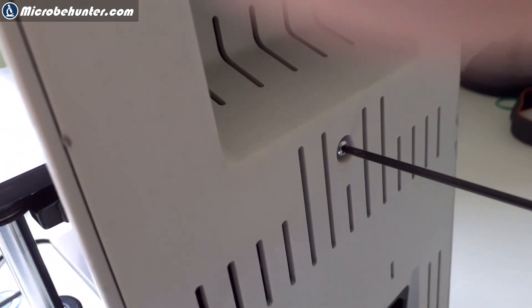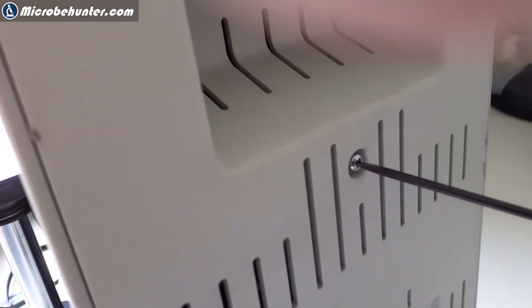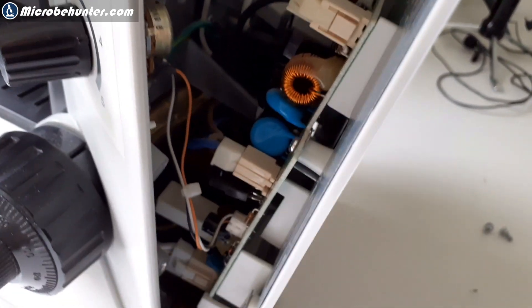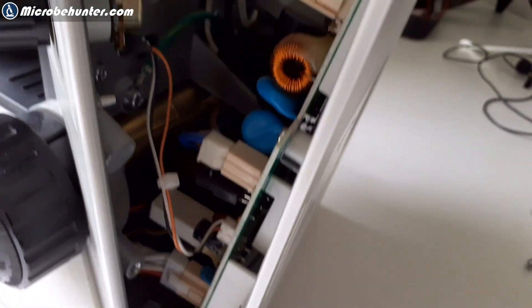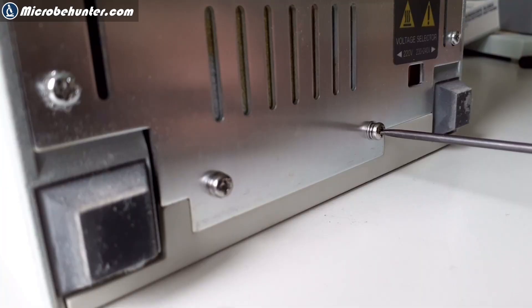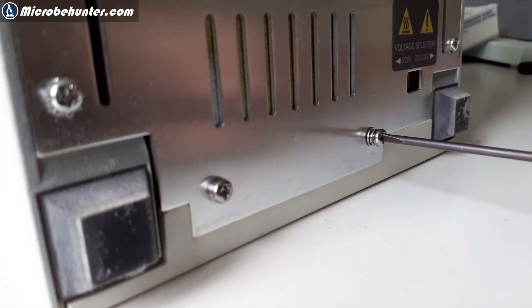I tried to clean pretty much all of the parts that could be accessed, but the dirt still is there. So I said, okay, it's time to give a general cleaning. I started to take the screws out in the back of the microscope. There are lots of electronics in there, transformers and so on, because I have a 12 volt halogen lamp. But that was the wrong place, really.